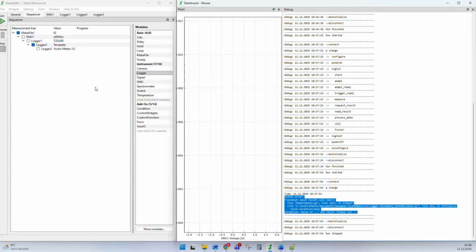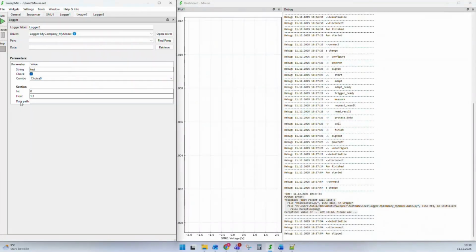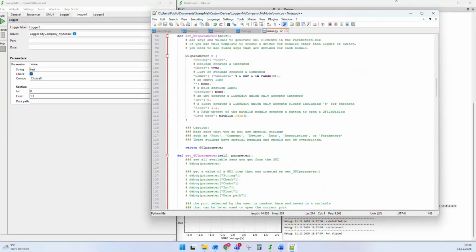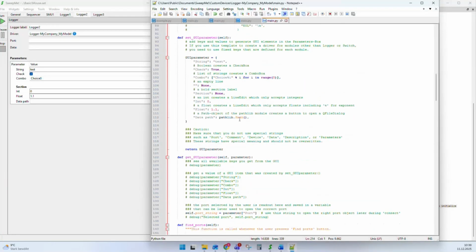The next part of the driver that I want to speak about is the GUI interaction. What you can see here in this logger template is that we have a custom GUI, a GUI that was created by the driver. And how to do this? There are two functions called setGUI parameter and getGUI parameter, and they are used to define a GUI parameter dictionary and return this GUI parameter dictionary. And this tells SweepMe which user interface you want to have.